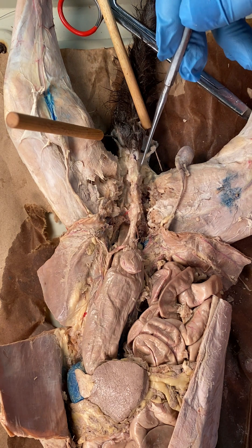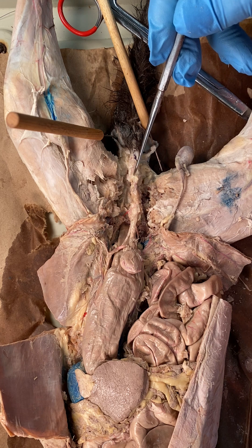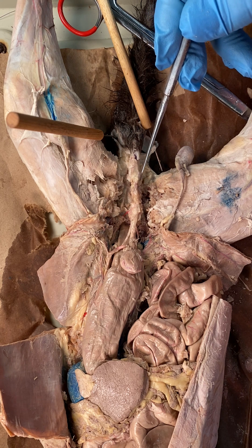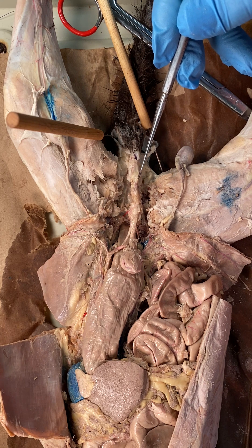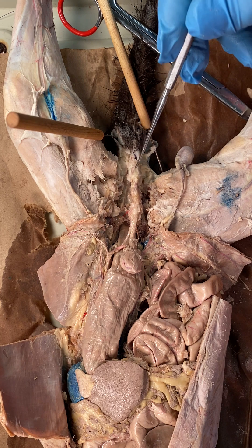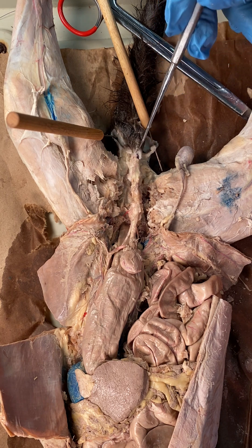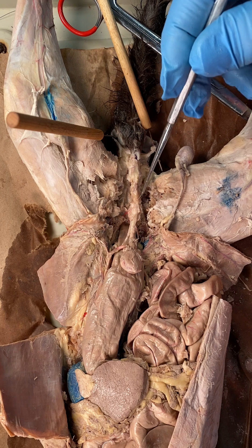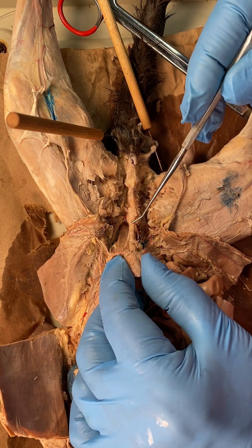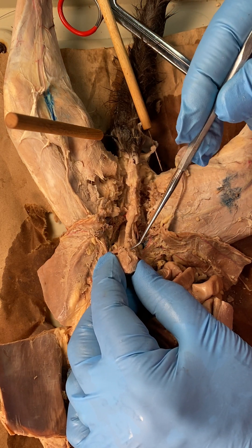That's the base of the penis right there. That little swollen area is where we see Cowper's gland, or bulbourethral glands. Then there's the shaft of the penis right there — that whole structure is the penis. Going into the penis is the urethra.